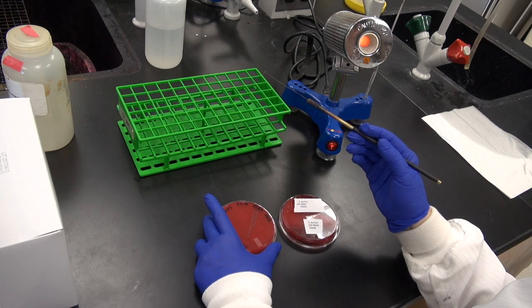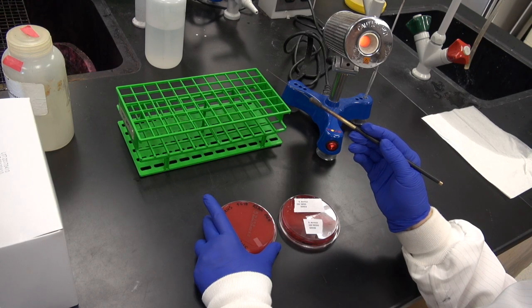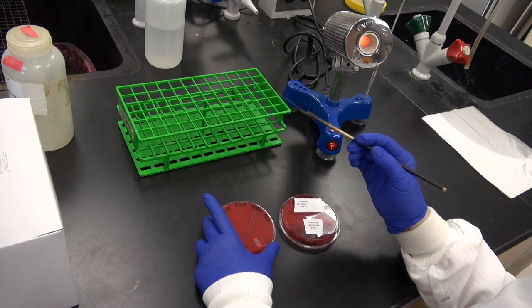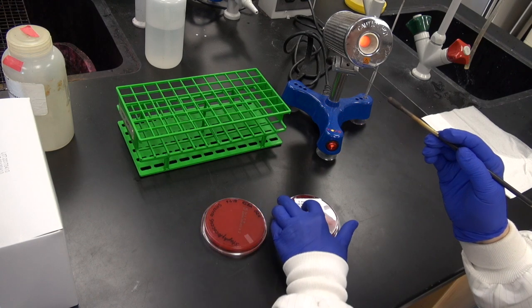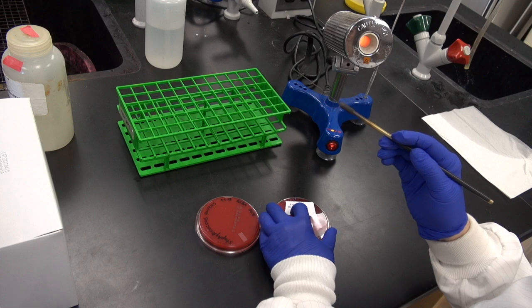Then we let the loop cool for 10 to 20 seconds before touching the colony of bacteria we want to transfer. This is so that the heat of the loop doesn't kill the bacteria on contact.